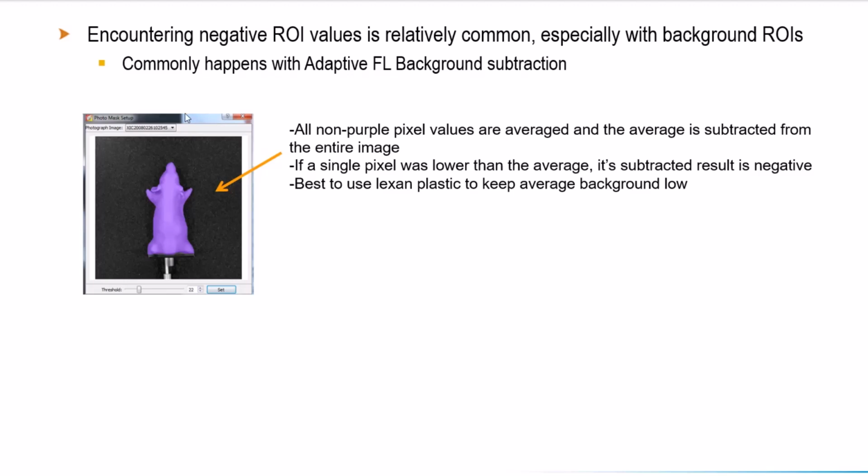The first instance is with fluorescence following adaptive fluorescent background subtraction. The software will average all non-purple pixel values and subtract them from the entire image. Thus, if the signal coming from your subject was very low, and a single pixel on your subject was lower than this average, it will result in a negative value.